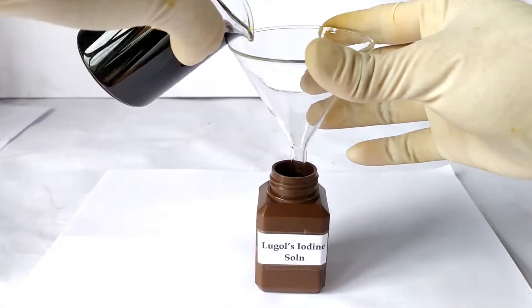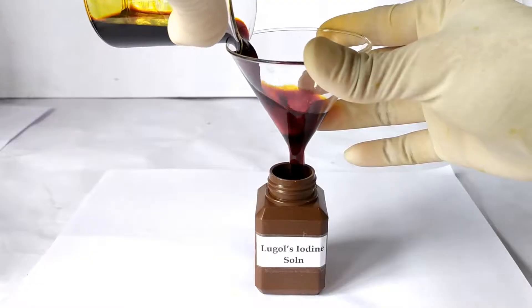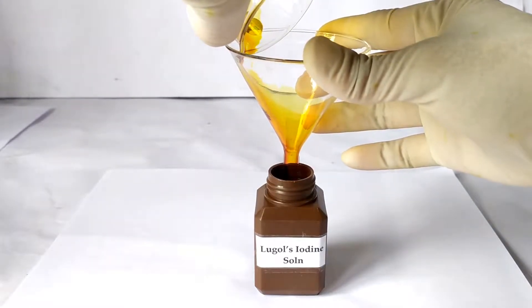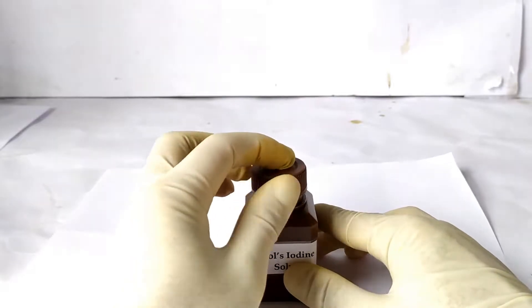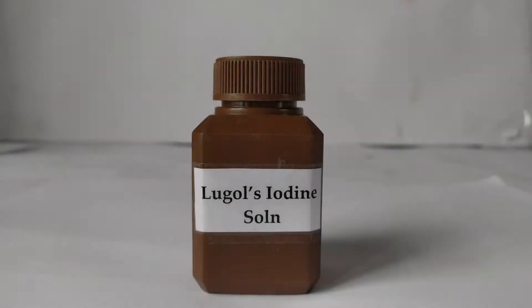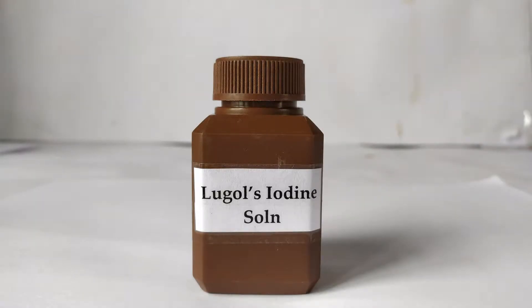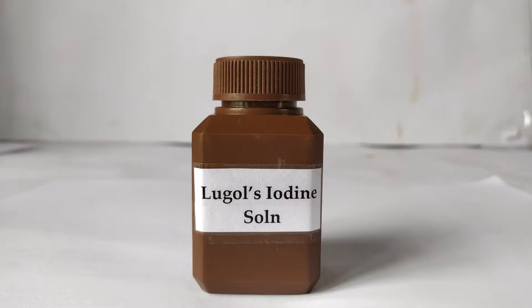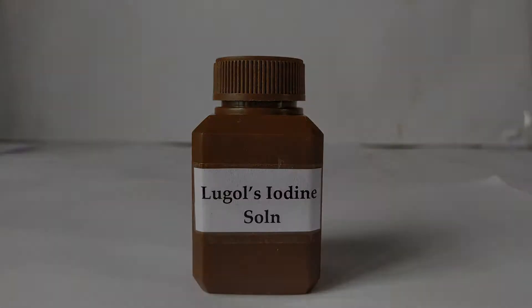Transfer the solution into the labeled brown bottle and cap it tight. You can also wrap the bottle with aluminum foil to increase the shelf life of the solution. Store the bottle in a cool dark place to prevent the chemical degradation of iodine. Lugol's iodine is thus prepared. To use this solution for testing starch, it may be further diluted with distilled water in a 1:4 or 1:5 ratio.